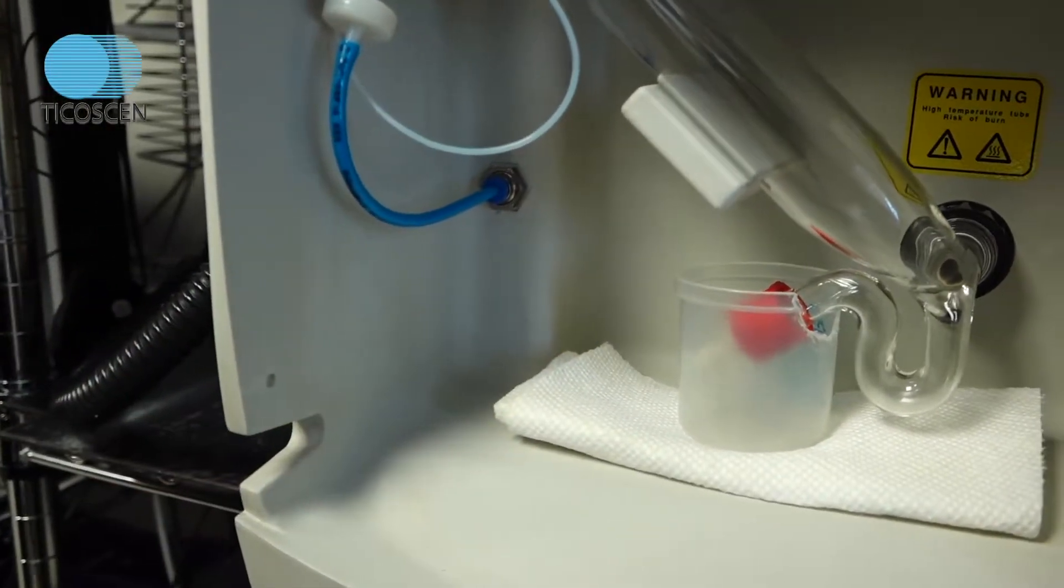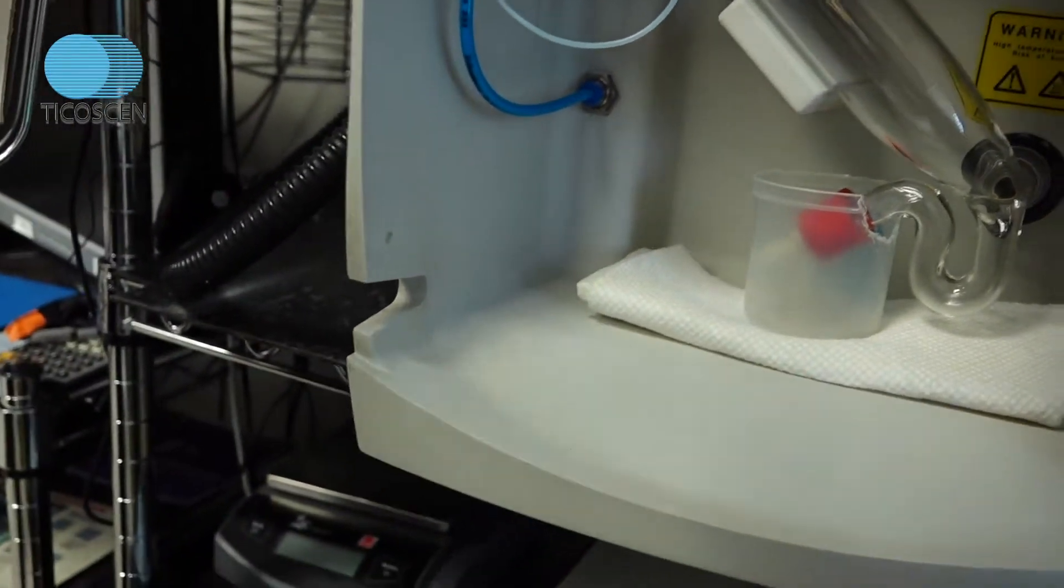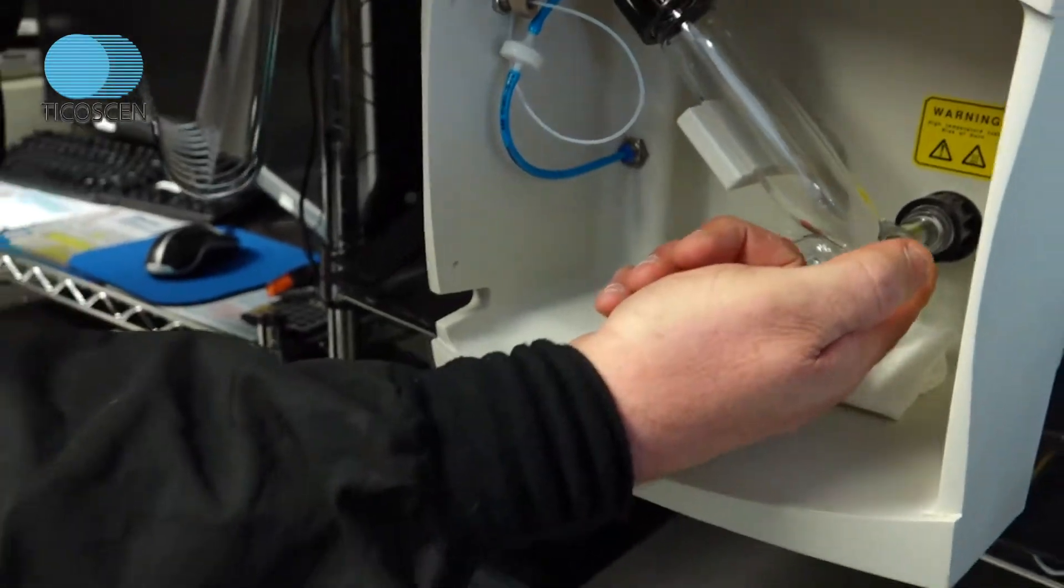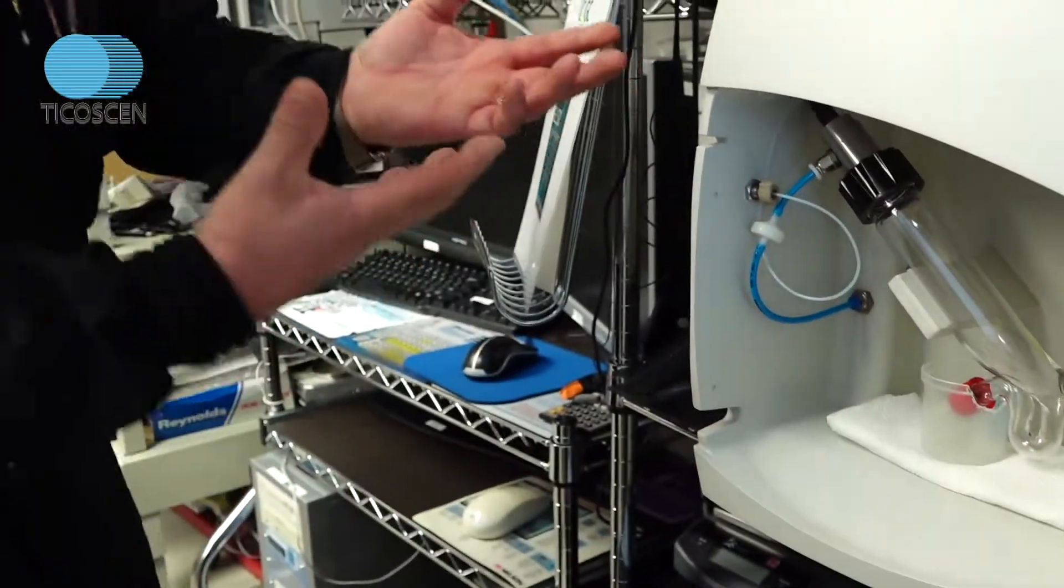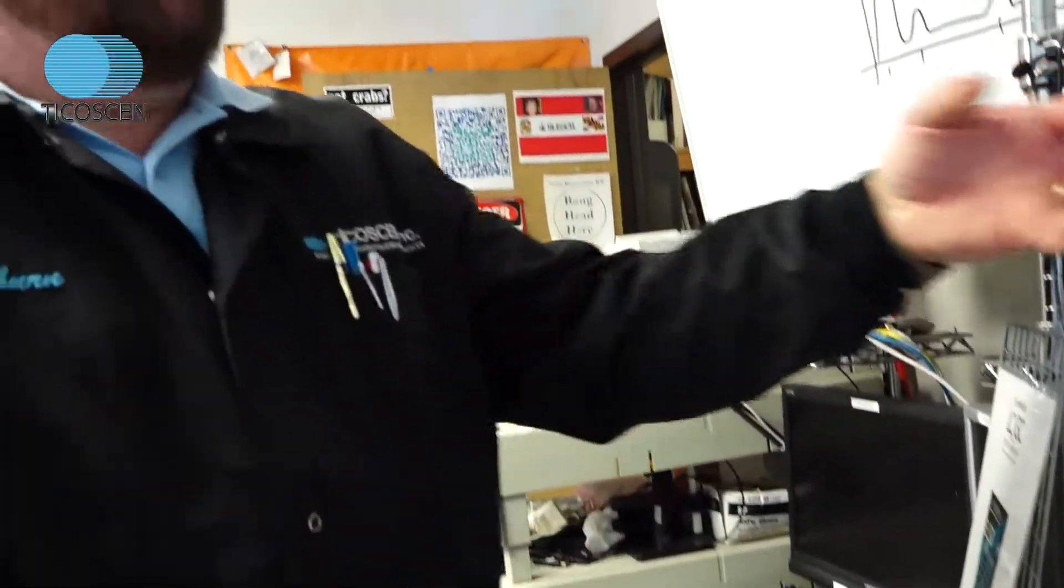And you'll have a drain line that runs down here to a solvent bottle. And your tiny MIE droplets will go into this drift tube, into the detector, be evaporated, and then scattered in the optical cell here at the top.